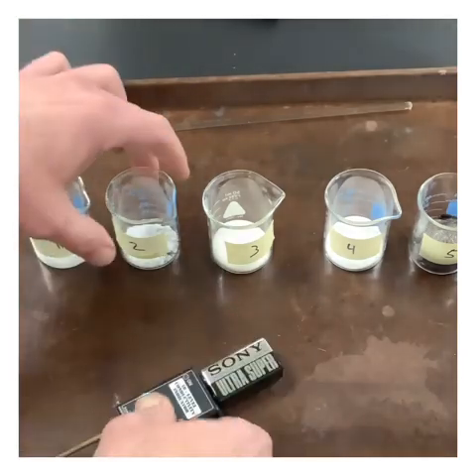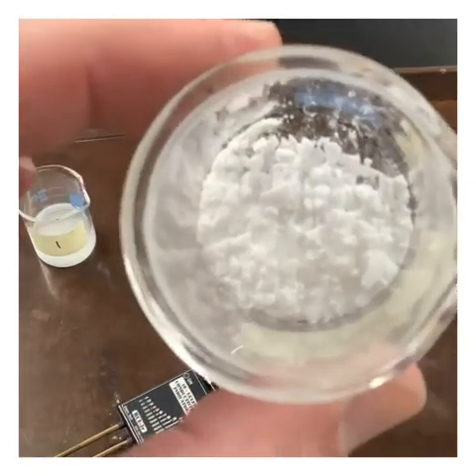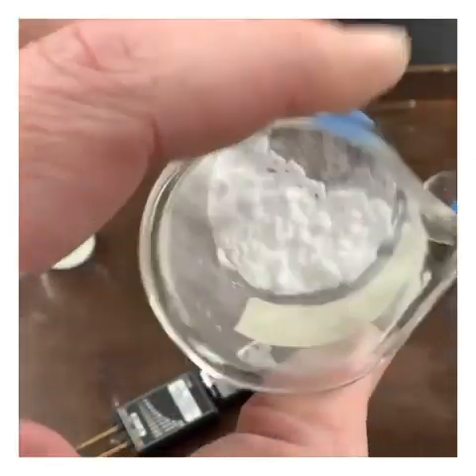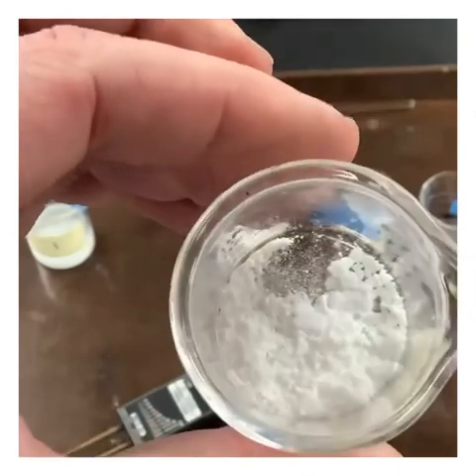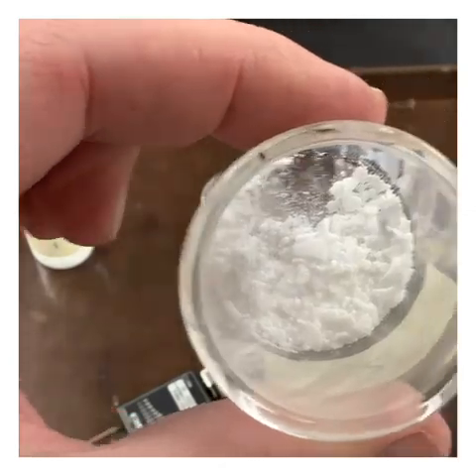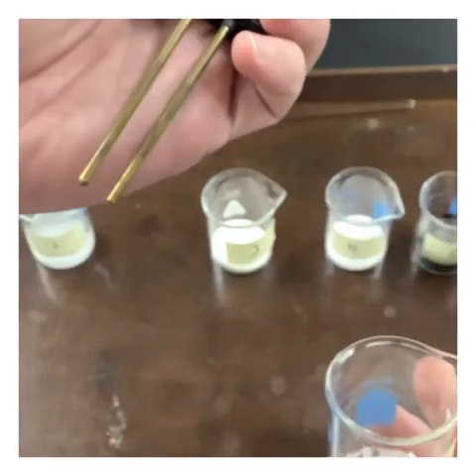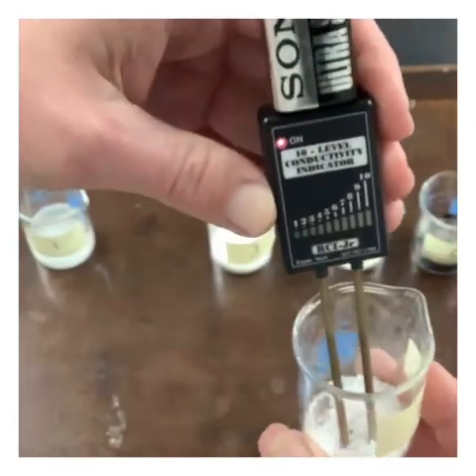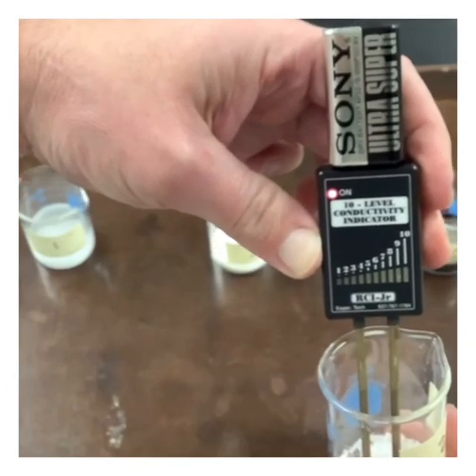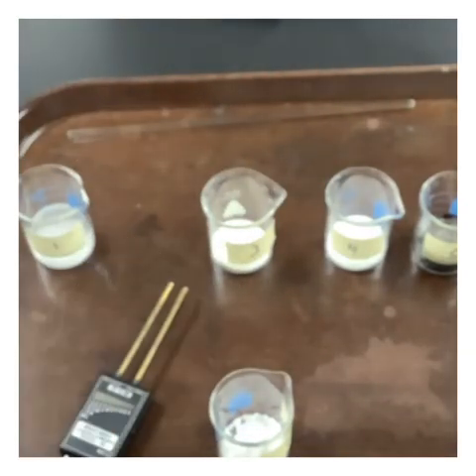Let's go ahead and take a look at our second chemical. Go ahead and make some observations on that. We're going to go ahead and test the conductivity as a solid. So we're not getting anything here. Let's get some water into it.